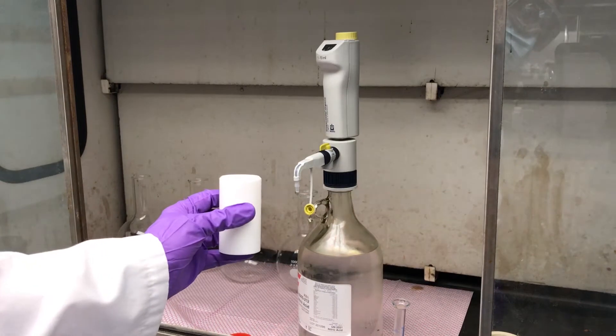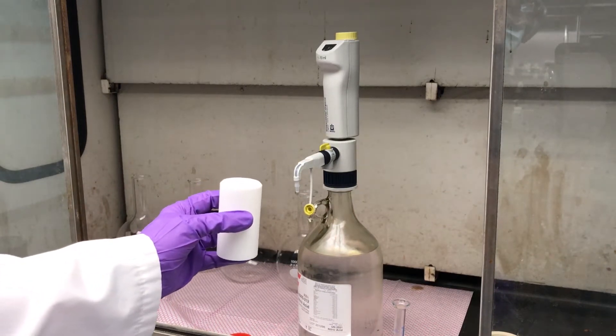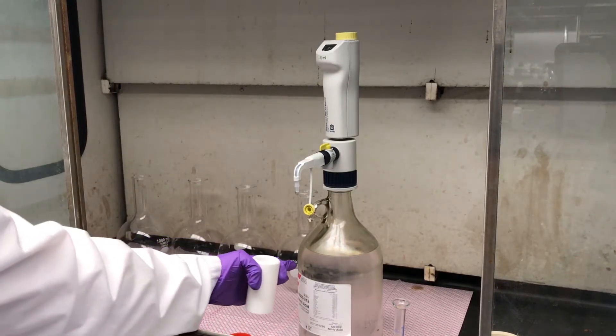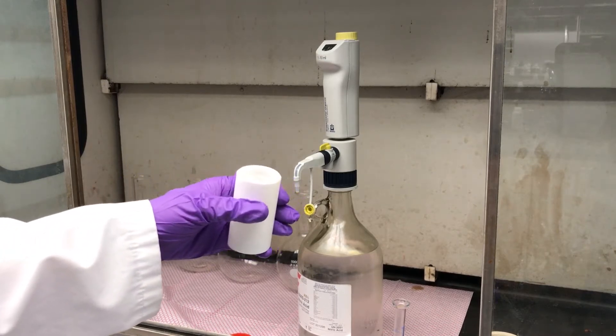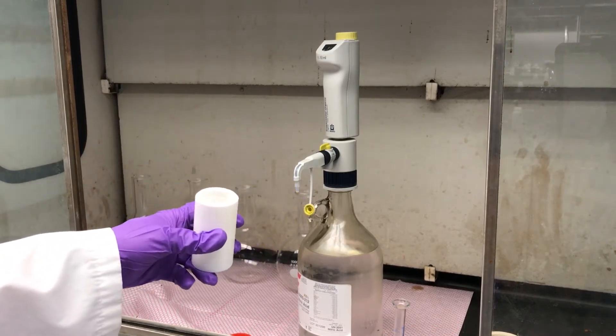All right, so now it's time to dispense five milliliters of concentrated nitric acid into our PTFE liner for the microwave acid digestion.